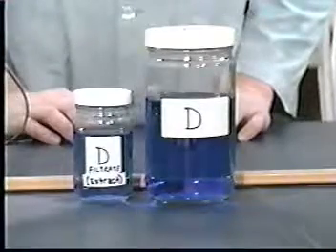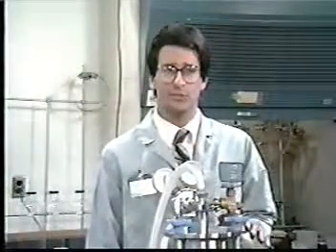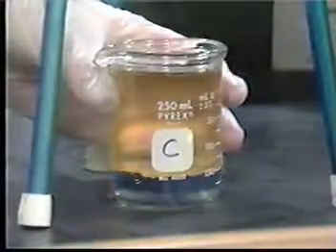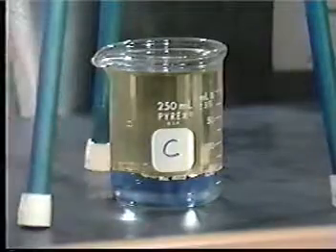When filtration is ended, measure and record the volume of the filtrate and the weight of the beaker containing it. If the waste sample was 99.5% liquid, like our waste D, then extraction is unnecessary and the filtrate should be aliquoted for analysis. Otherwise, the liquid must be stored in a sealed refrigerated container for eventual combination with liquid which results from extraction. Recall that if the initial liquid phase is not water-soluble, then the two liquids will be analyzed separately and the results combined mathematically.